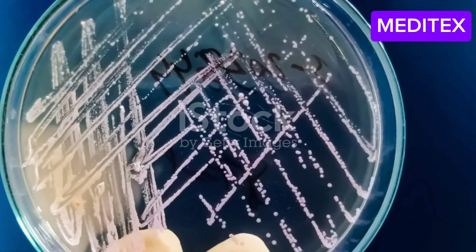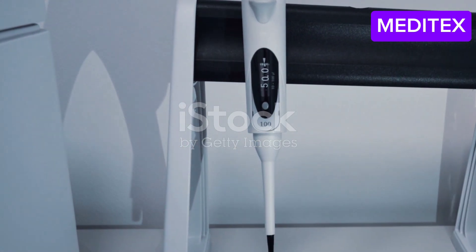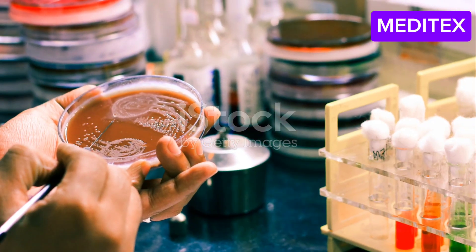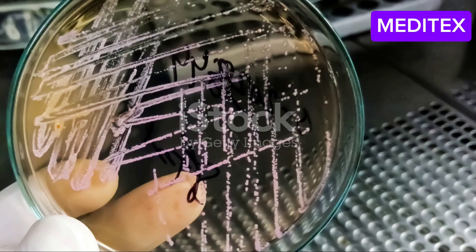Now it's time to prepare your WFI samples. Pipette the required volume into sterile tubes. Make sure your pipettes are calibrated and you use sterile techniques all throughout.